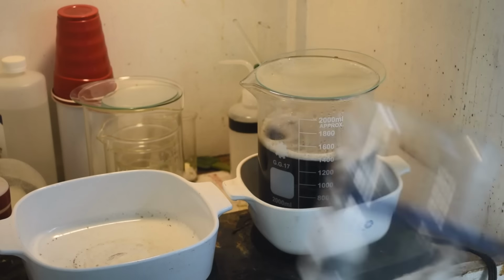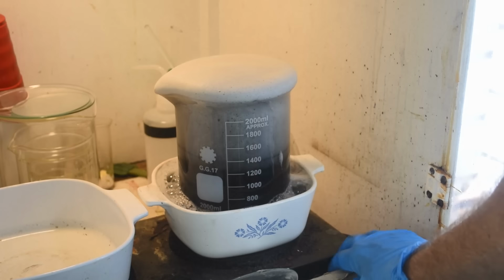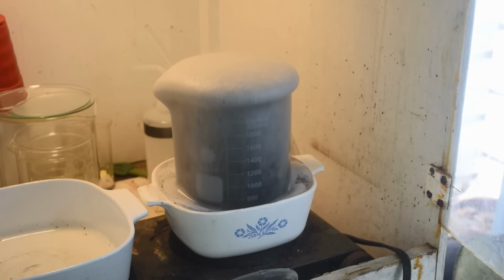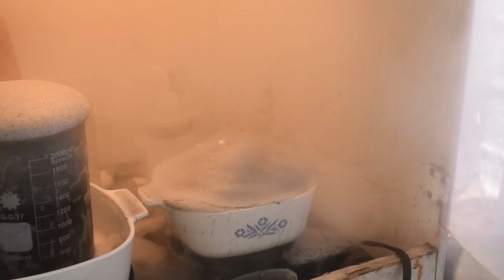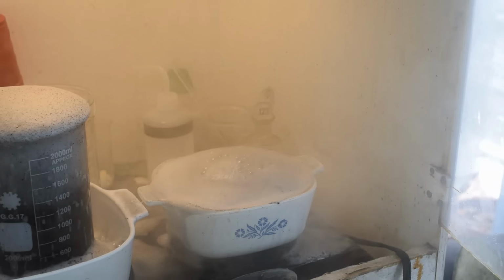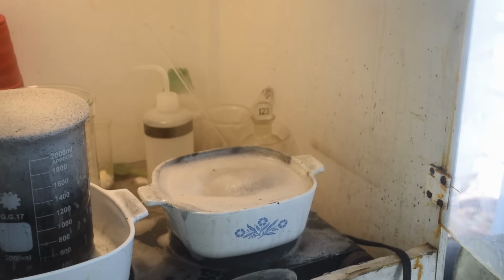I'm gonna clean this beaker out. Well, there's a bit of a problem. We had a bit of a boil over, but the CorningWare dish looks like it has caught it. We get the heat off, and we're still boiling over. Rats. All right. Where did I just put that? Most of it, but not all of it. So, a little more loss there.